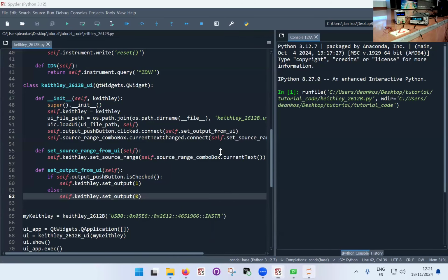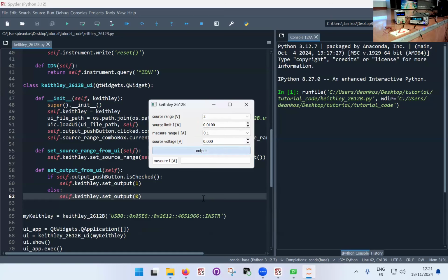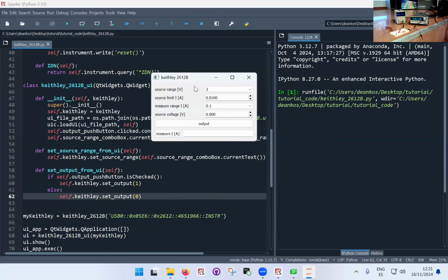But this is kind of the actual way to do it. So I'm going to rerun it. Okay, so I turn the output on, and you see now the button changes into sort of like a pressed state, and then I depress it, and it turns off. Okay, there it is. So it works. The other thing that I can try is the set source range from UI. I don't know whether you'll be able to see, but the people closer here can see if something happens. So let's see source range. Yeah, you can see actually something happening here as I click. There's a little comma that moves. It's very subtle, but anyway, it works. Okay, so I'm happy with that.